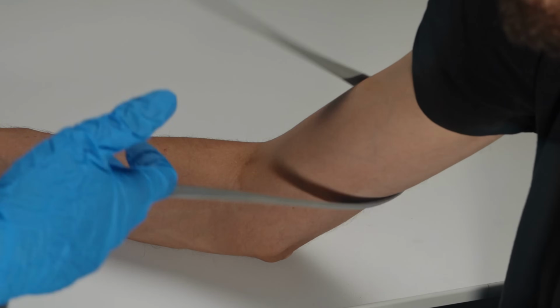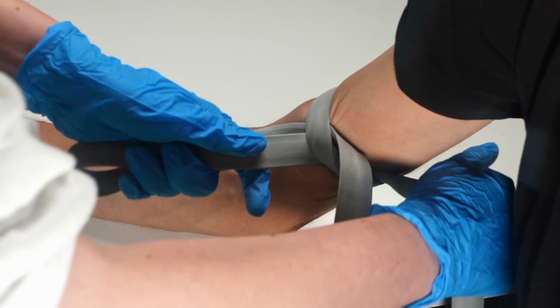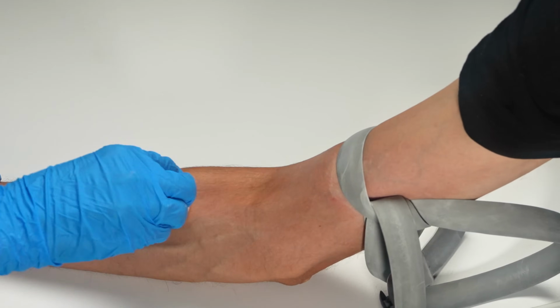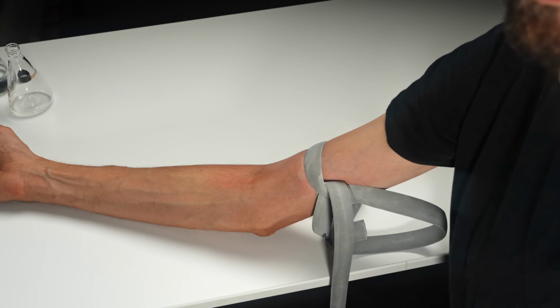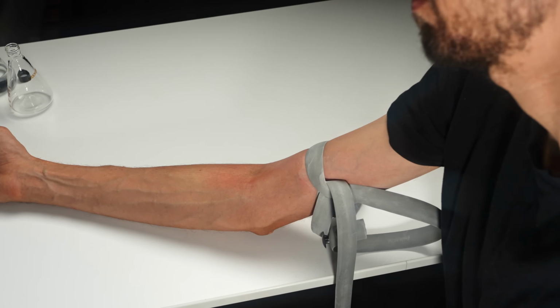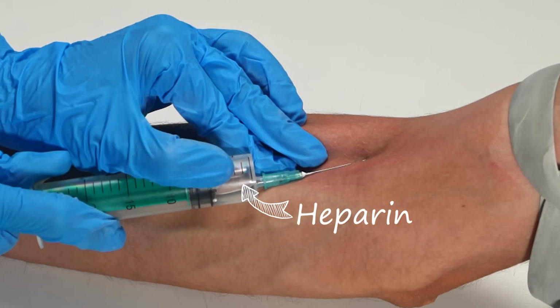Hey guys, today I'll show you some chemical reactions with blood. For these experiments, I'll be using my venous blood. To prevent it from clotting on its way to the lab, I'll premix it with a small amount of heparin. Heparin will not have any effect on the reactions.